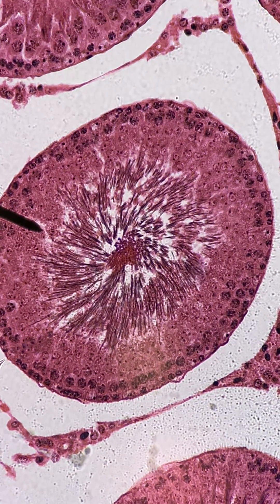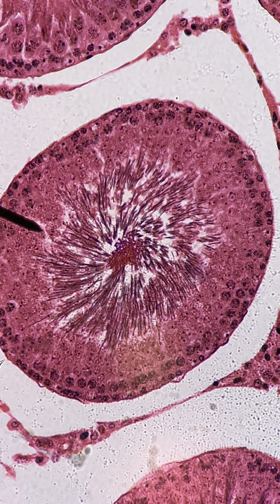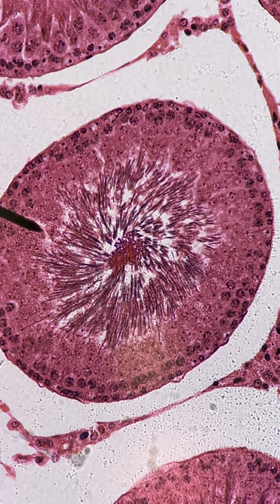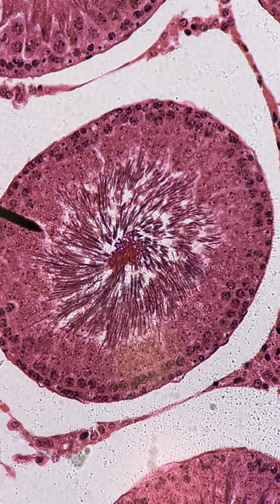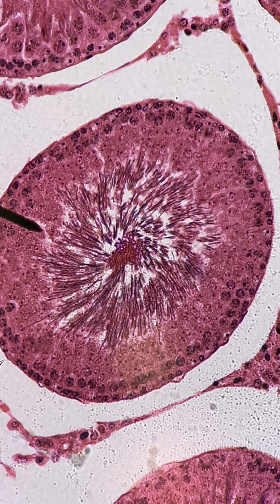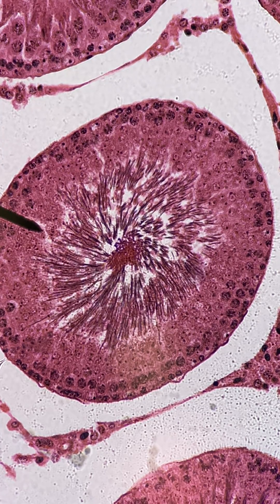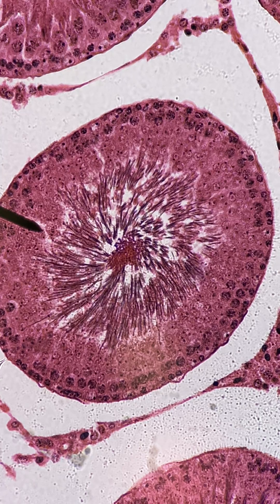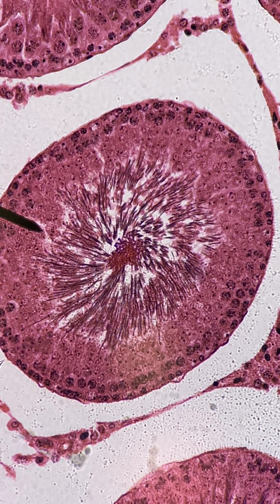Here is a high-power magnification of the testes. This big circular structure you see there is called a seminiferous tubule. It's seen in cross-section, so it would have been coming straight towards you. Those little swirly things towards the center are actually the flagella of sperm cells that are being manufactured.